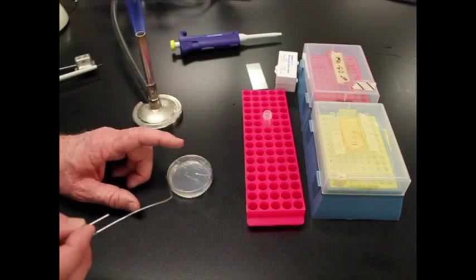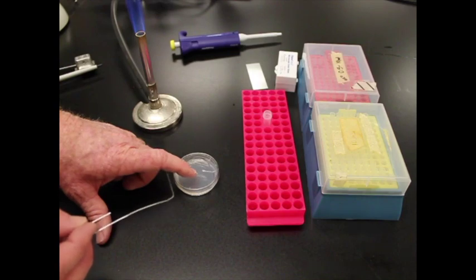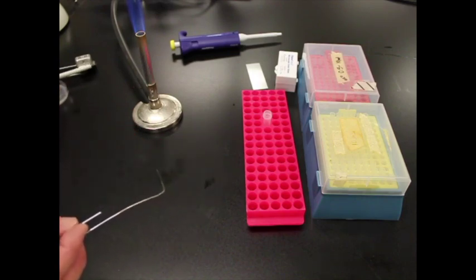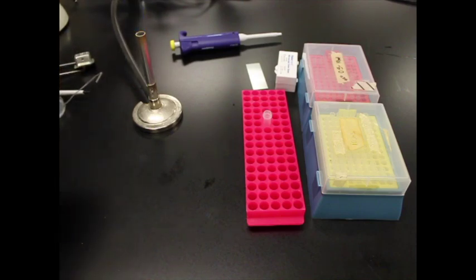Or actually, sorry. Label this plate and then we'll put it in a stack all together so that these can incubate underneath the grow lights. Now I'll flame my spreader. And that guy's all ready to go. And then I'm just going to turn off my heat because I'm not going to need it again.